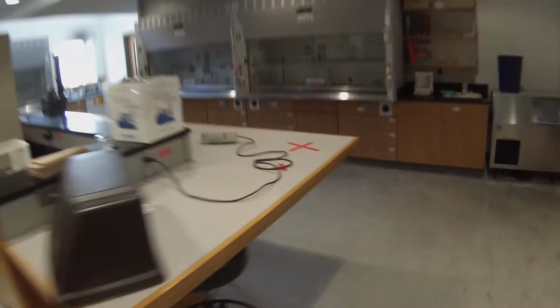I'm going to actually create a new folder that says IR of purified samples. Set file name to title, and we'll save that. We'll process them later. So now let's go grab the cinnamic acid.